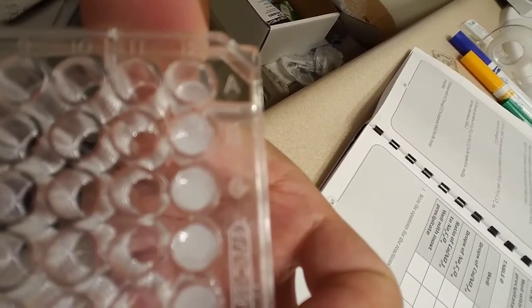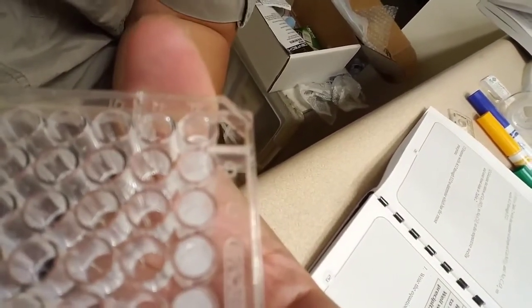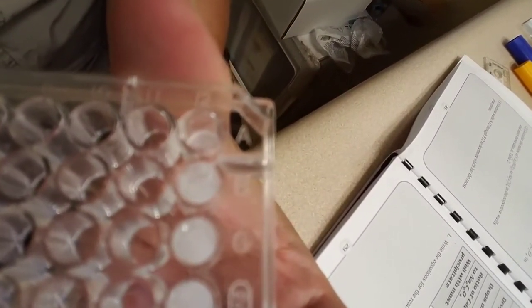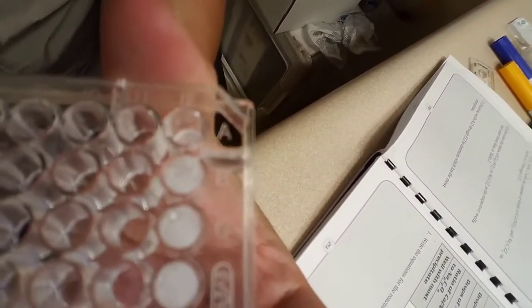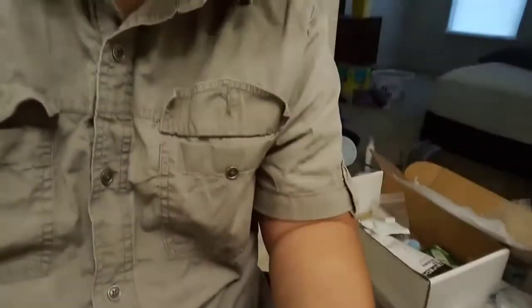Okay. So it's hard for me to see what you can see. But what we're trying to figure out is whether a precipitate has formed. What you're going to want to see if you see a precipitate is that the original liquid that went in was clear, and now, obviously, you can see that each is quite murky. That murkiness is actually some kind of solid forming as those two things react with each other. So that's what a precipitate is.